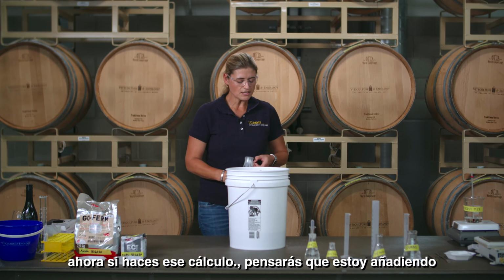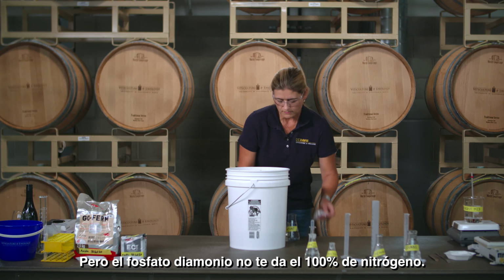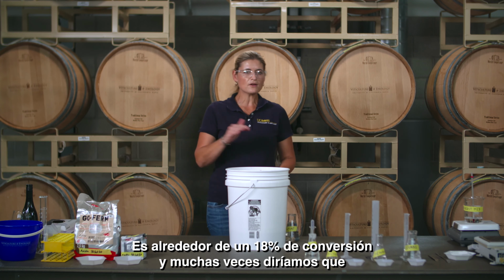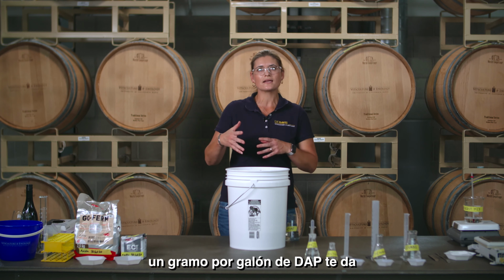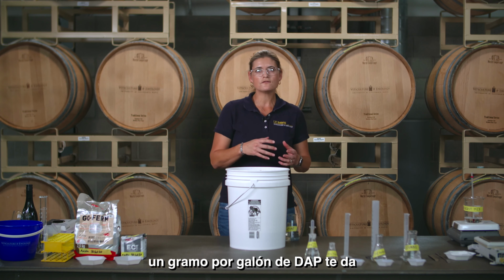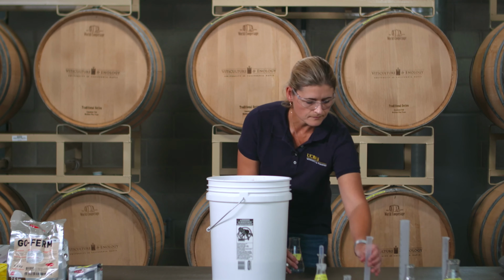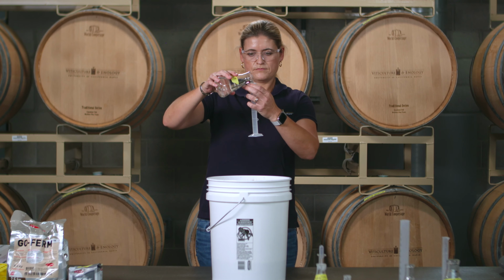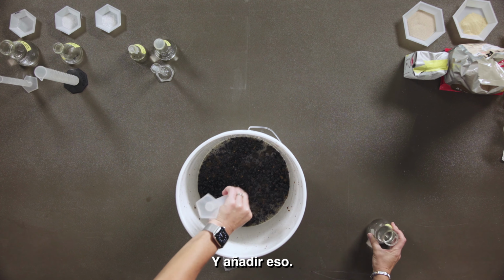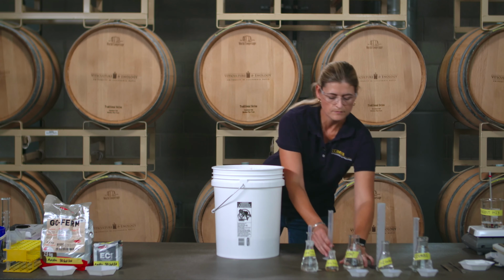Now, if you do that calculation, you'll think, but I'm adding way more than you expect. But diammonium phosphate does not give you 100% nitrogen. It's about an 18% conversion, and many times we would say 1 gram per gallon of DAP, or DAP gives you about 50 milligrams per liter of nitrogen. So let me measure off 23.3 milliliters. And add that. Once again, you have to mix it really well.